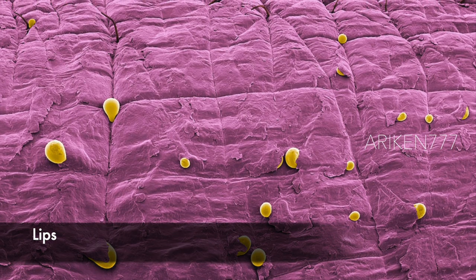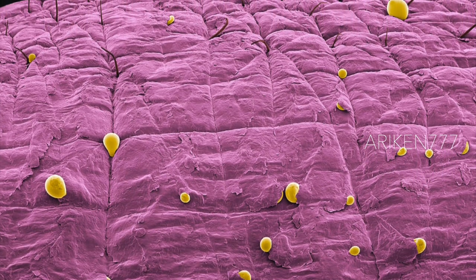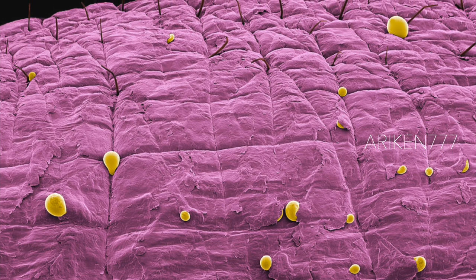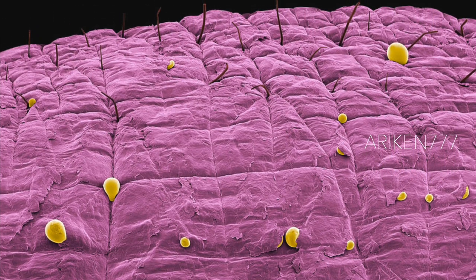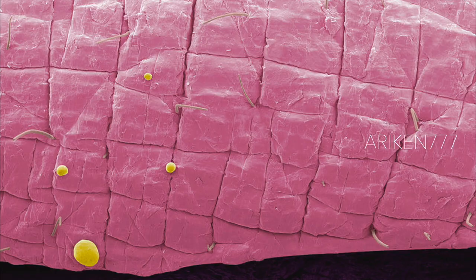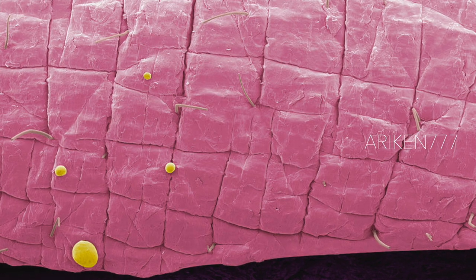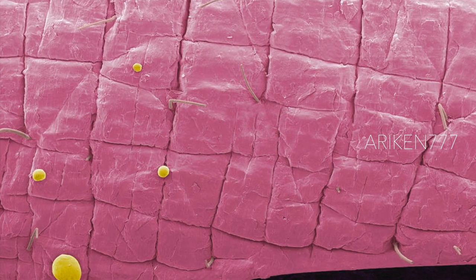Human lip skin. This view shows small hairs, the cracked lip surface, and sweat and oil droplets. The skin of the lip with 3–5 cellular layers is very thin compared to typical face skin which has up to 16 layers. With light skin color, the lip skin contains fewer melanocytes. Because of this, the blood vessels appear through the skin of the lips, which leads to their notable red coloring.